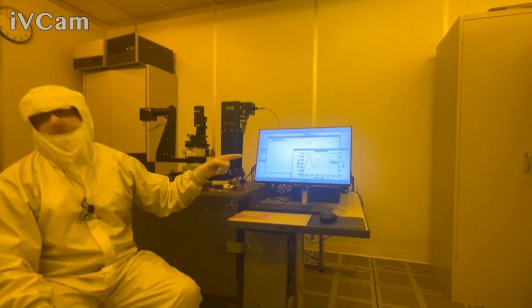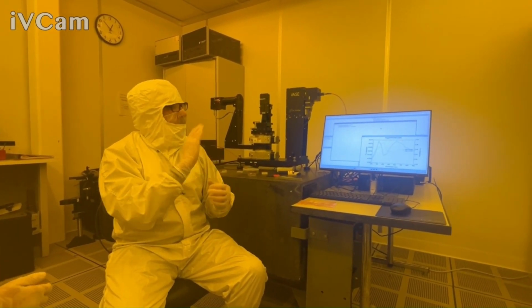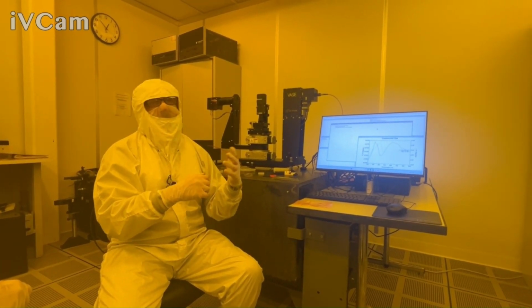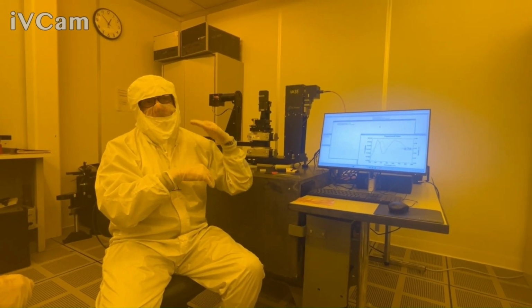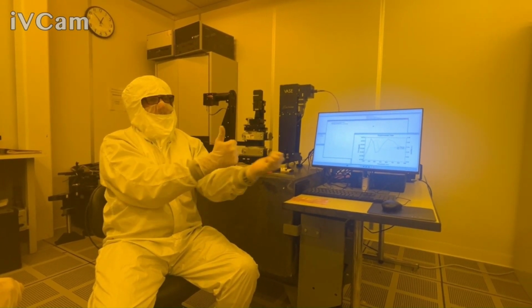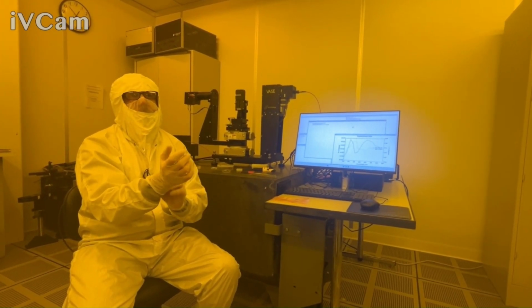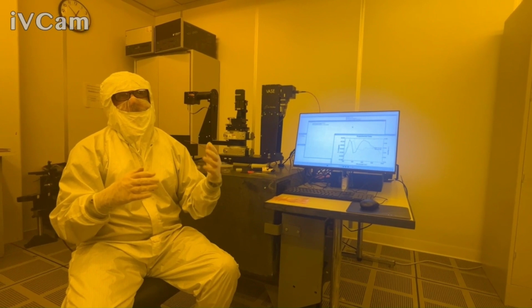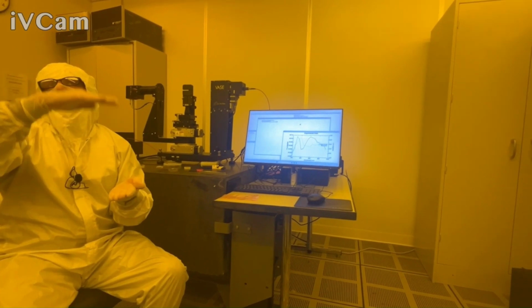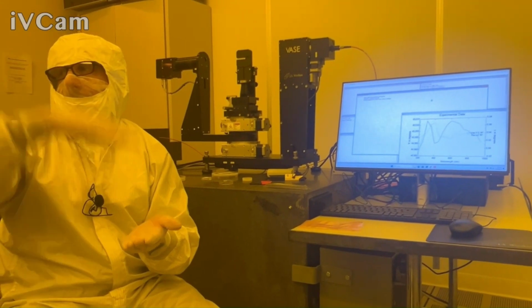Now, if we were not using the auto retarder here, delta would be very, very noisy, because if you're just trying to linearly polarize light, delta is basically undefined. Whether it's right or left circular, your delta itself can vary over a 360-degree range. You have a phase delay between wave 1 and wave 2, and every full wave it repeats itself. Basically, if you don't use the auto retarder, delta is noisy at 0 and 180, and we're at 0 right now. You don't know the handedness, so you can only measure from 0 to 180 rather than 0 to 360.